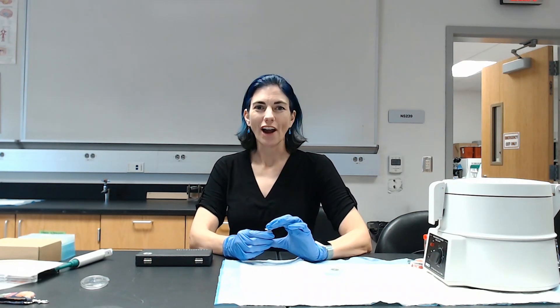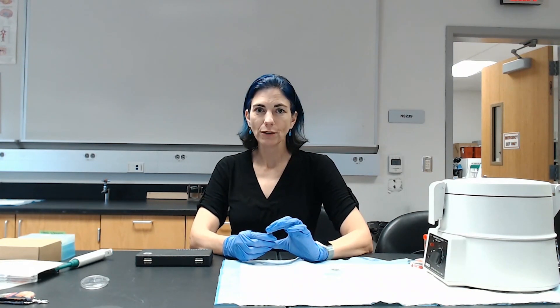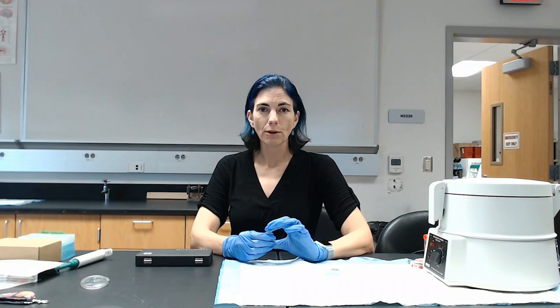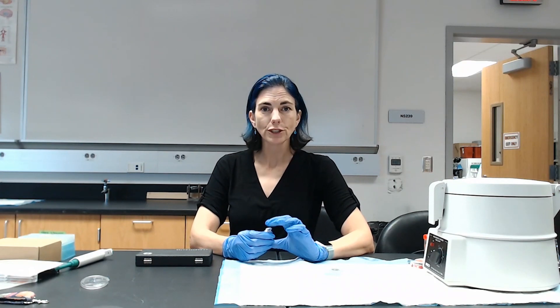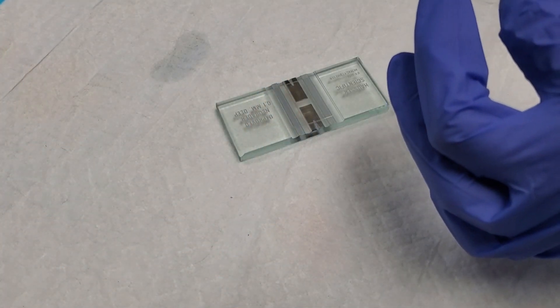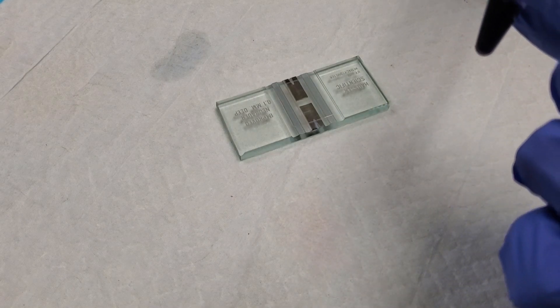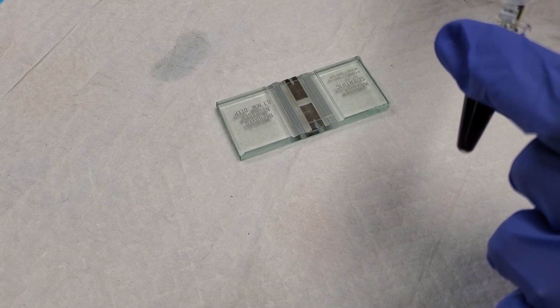We're going to switch over to the hemocytometer view. You'll be responsible for doing your own counts, just like for the red blood cells. Then we'll turn and take a look at differential counts.